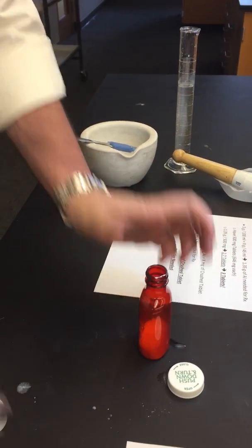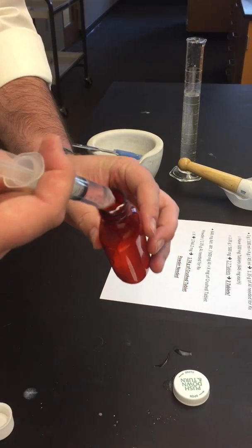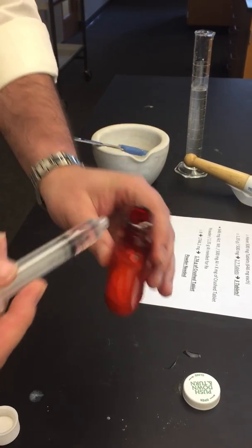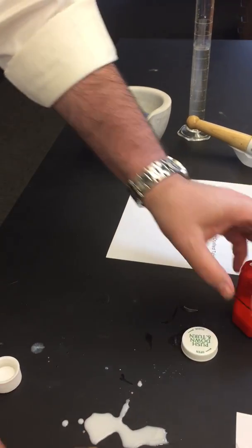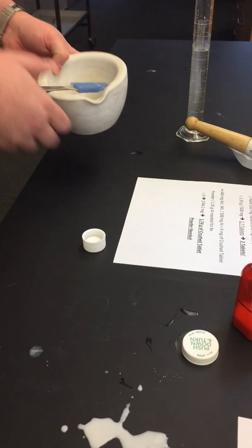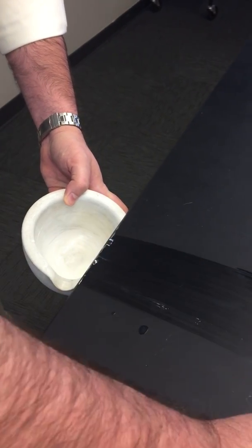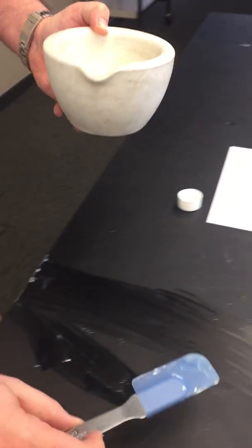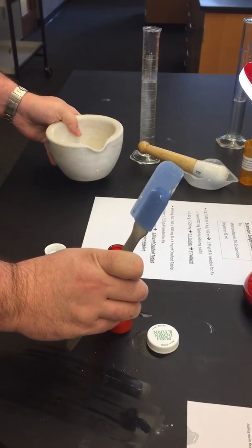At this point, we're pretending that this is our triple fish flavoring. We would add in our desired amount of flavoring. In this case, we do 1 mL. You always want to add the flavoring in towards, oops, don't do that. If this happens, this is actually a great example. You don't have to start from fresh. You can actually use your latex spatula and go straight off the side, assuming that you cleaned your workstation first, and there's no reason to start over. That's a great trick that pharmacists can use all the time. Reincorporate it back into your 2-ounce amber vial, and you're good to go.